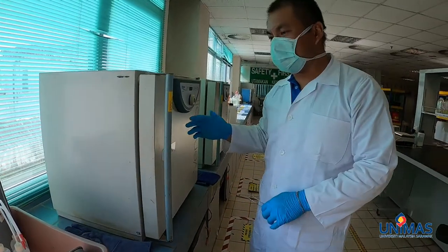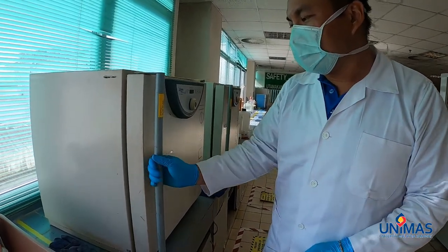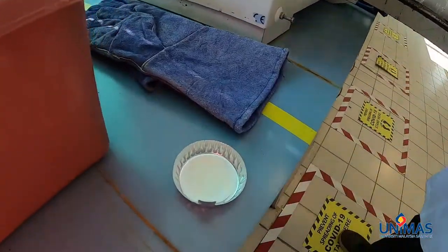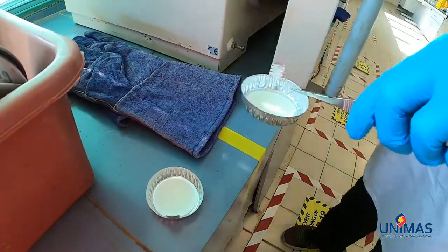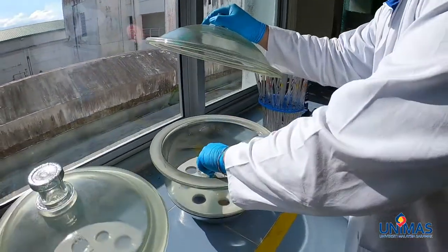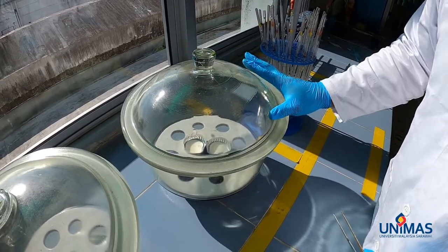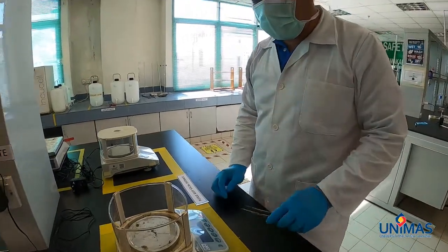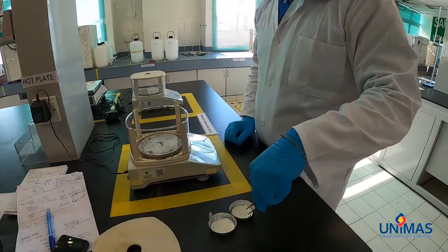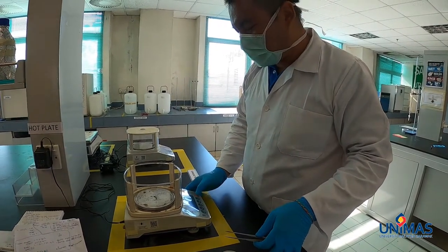It is already past an hour with the samples kept in the oven, so now I am taking them out. We are going to place them in the desiccator to cool down first, repeating the same process as we did earlier. Once the samples have cooled down in the desiccator, what we are going to do is measure the weight with the sample on the disc.